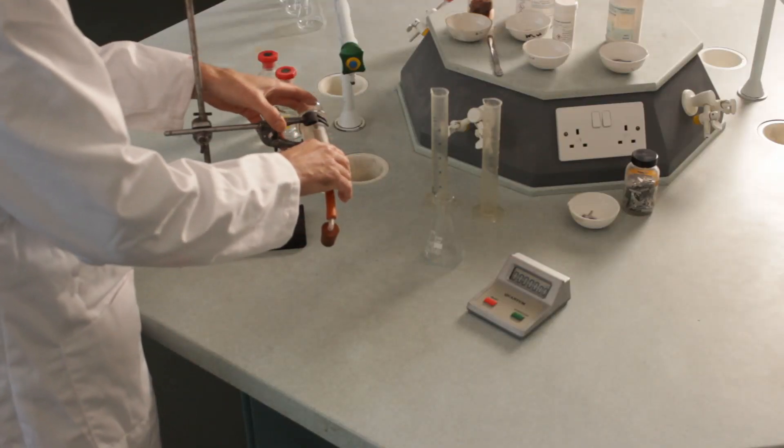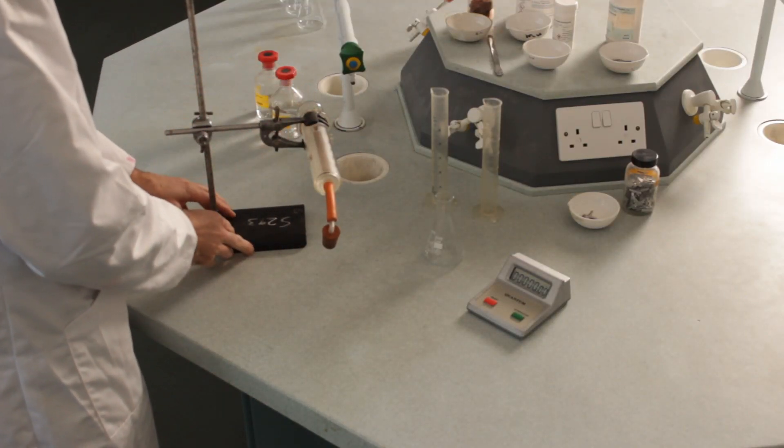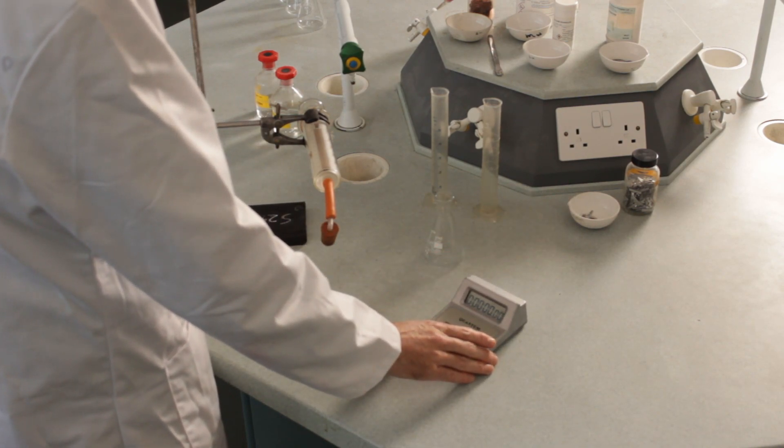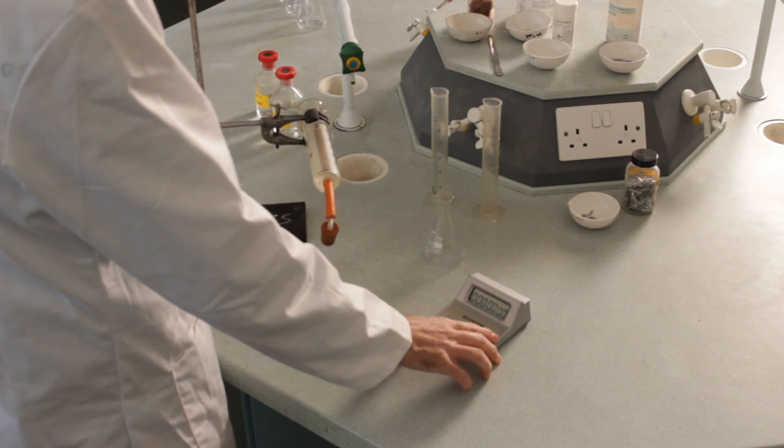So this is what I'm going to record the volume of gas in this gas syringe. Obviously, I'm going to start the stop clock because I'm going to record the volume after a minute has passed.